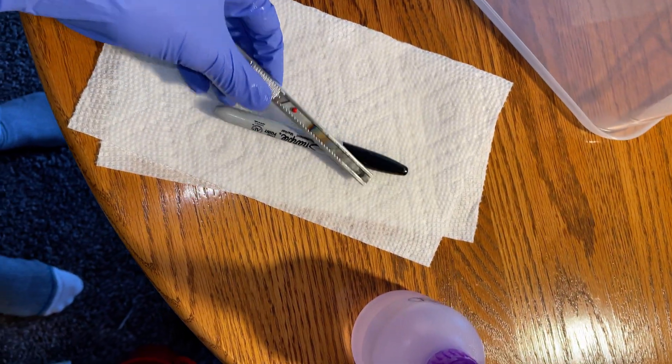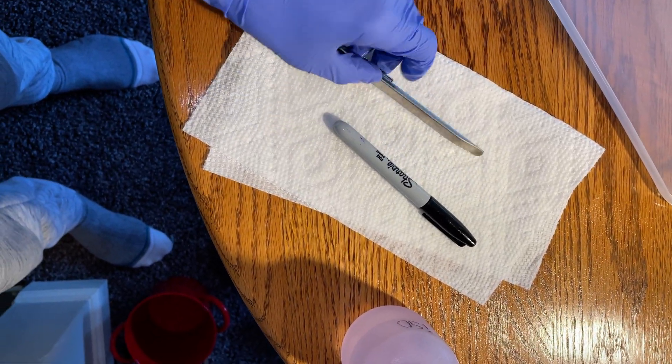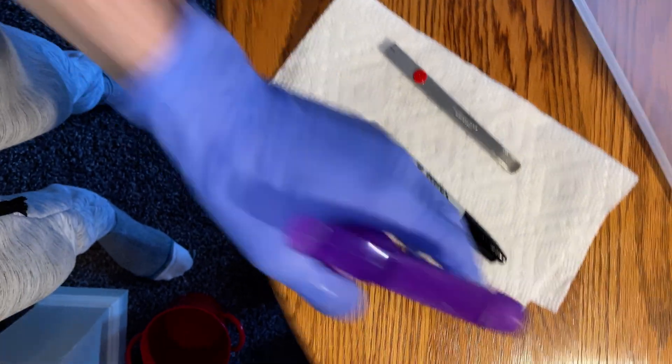And I also make sure to spray my tools down, spray the paper towel down before they go down, and then I put them on, spray them, flip them, and spray them again.